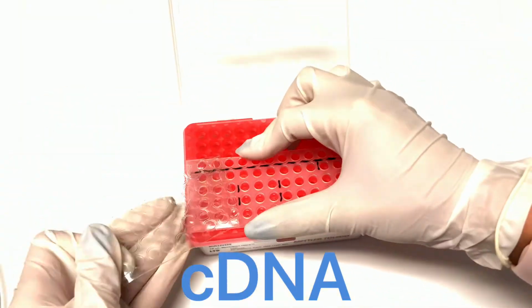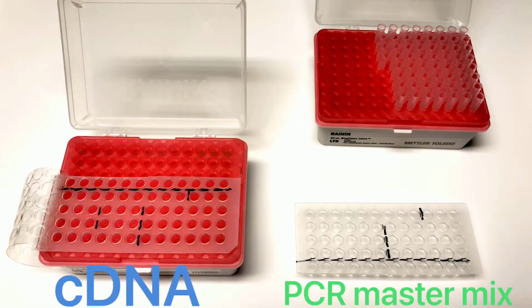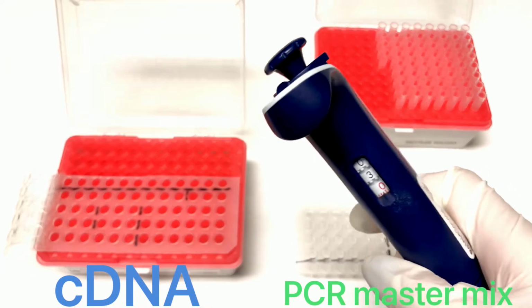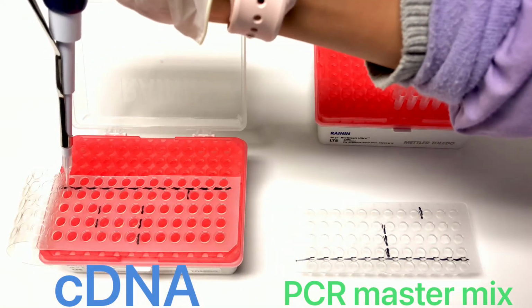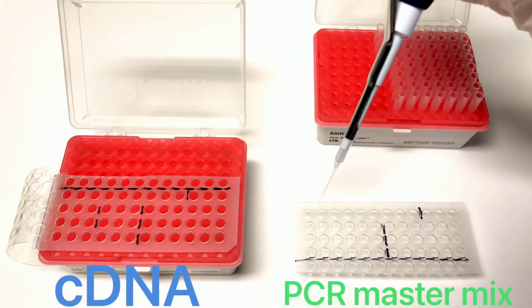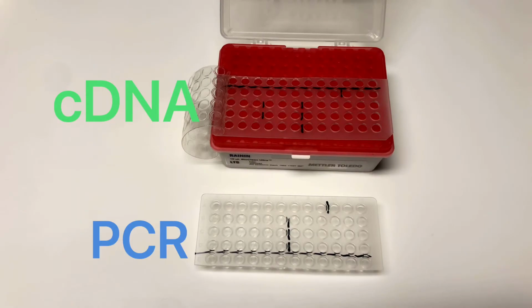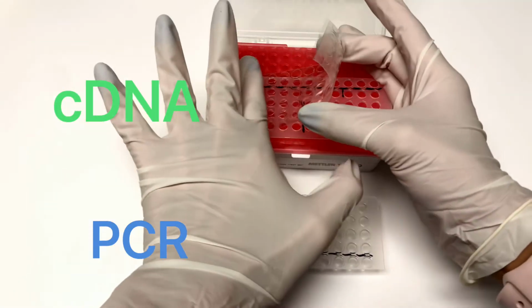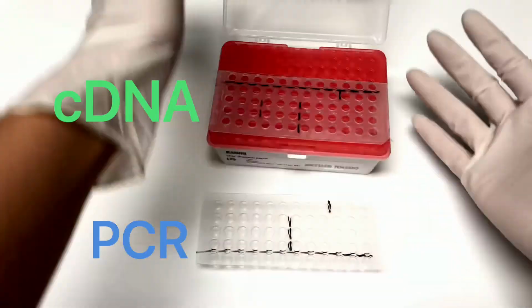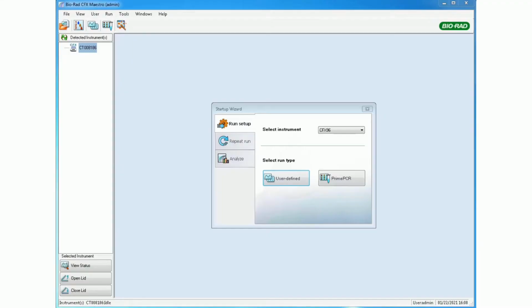Gently remove the plastic film from your RT plate. Set a pipette to 3 microliters. Transfer 3 microliters of your sample from your RT plate to the PCR plate. You may reseal your cDNA and store it in the fridge if you wish to revisit it. Cover your PCR plate and spin it down.